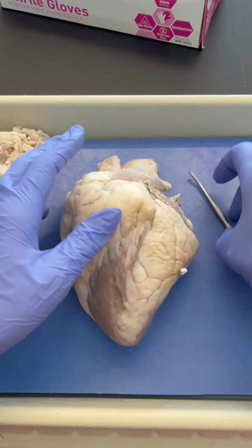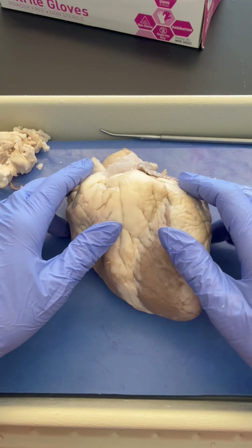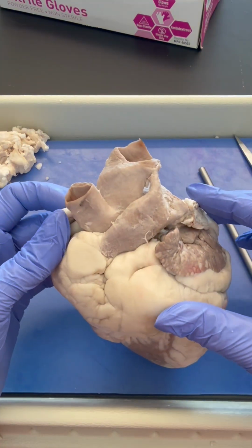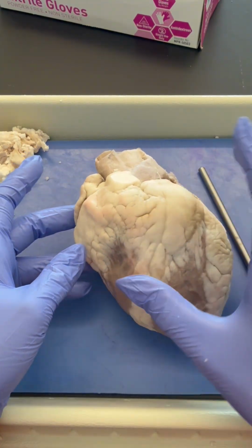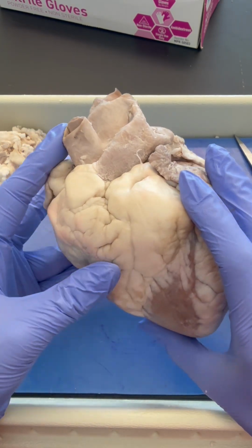Okay, the last thing about the anatomical position here is that the apex of the heart would be positioned slightly toward the organism's left lung. So it doesn't sit with the apex directly facing downward. And you'll notice that the left ventricle is quite a bit larger than the right ventricle. We know why this is, but we'll talk more about it when we actually cut into the heart with our frontal coronal cut.